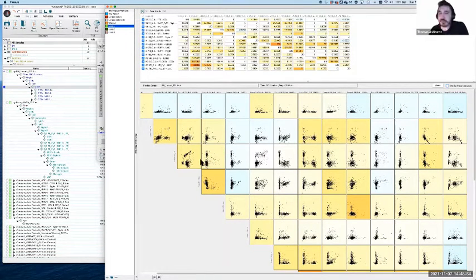Just out of curiosity, I don't know how good the resolution is for those watching, so you might not be able to see it. I'm sure you won't be able to read the text, but is there any spot on the screen where someone can see some errors or some potential errors that we might want to tackle? So this is probably a bit of a redundant question because you have no way of actually telling me where those issues are.